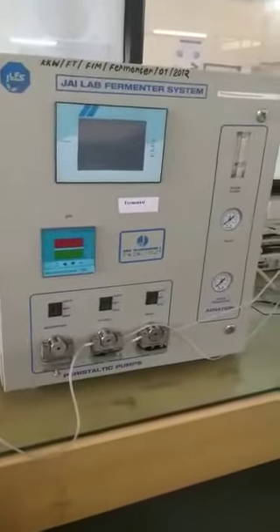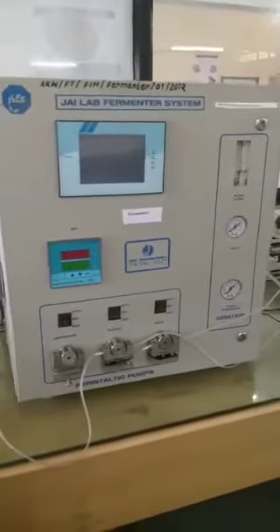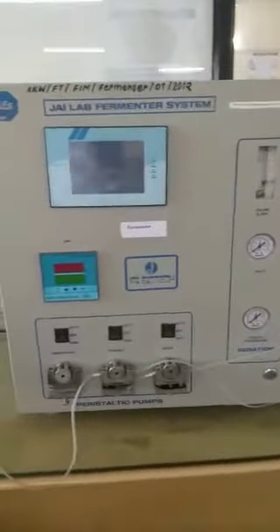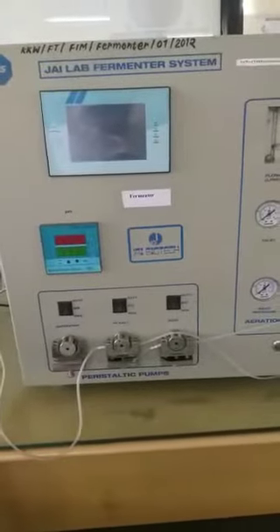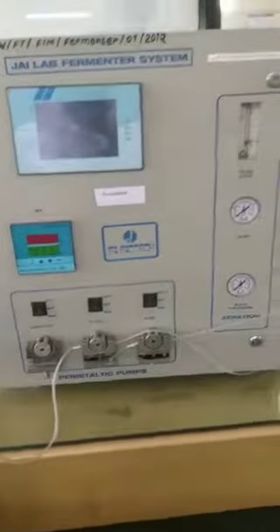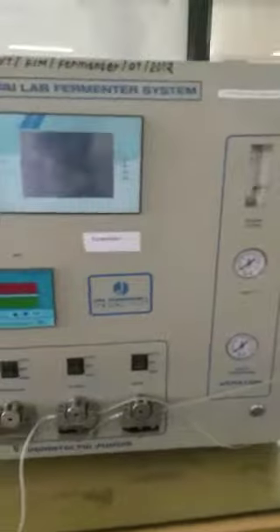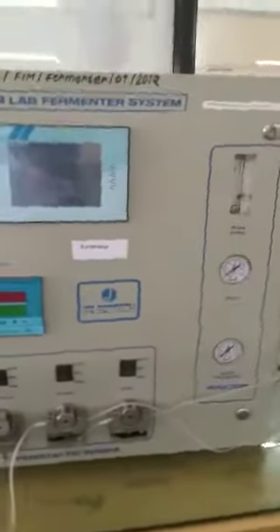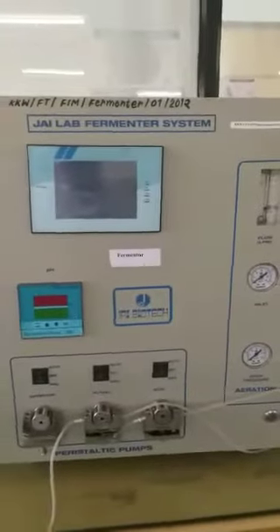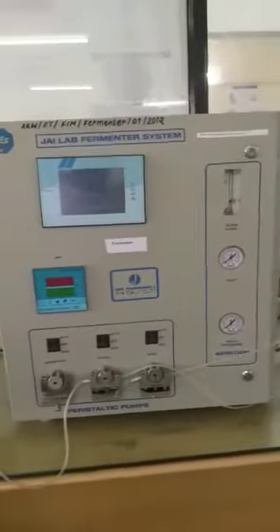Good morning to one and all. I am Mr. Mabudur Rahman. Today I will cover the topic of parts of a biofermenter. We are seeing here the parts of the biofermenter.